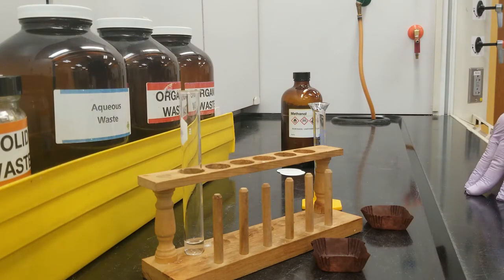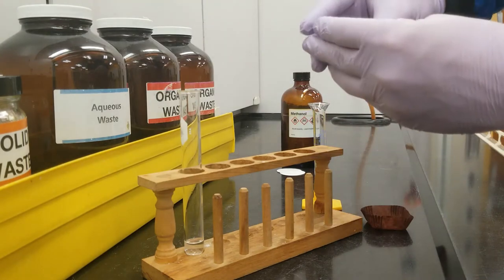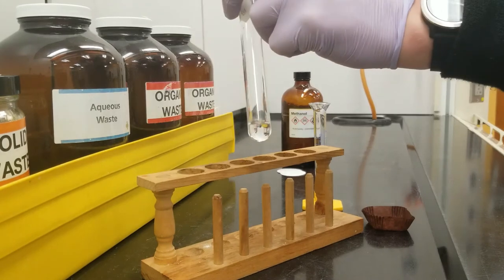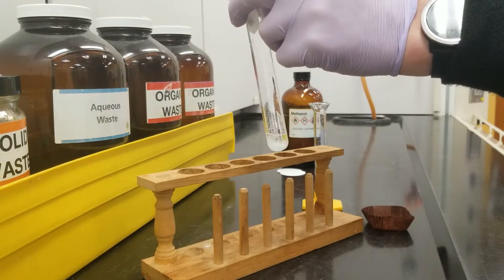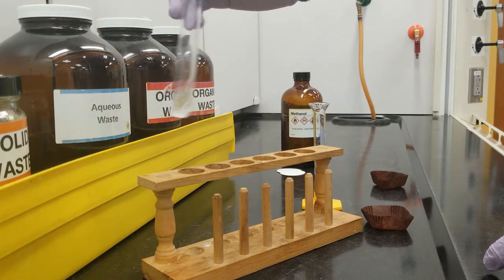So the first step in our reaction is to dissolve our benzophenone into two milliliters of methanol. And this can be done just by shaking for a minute.